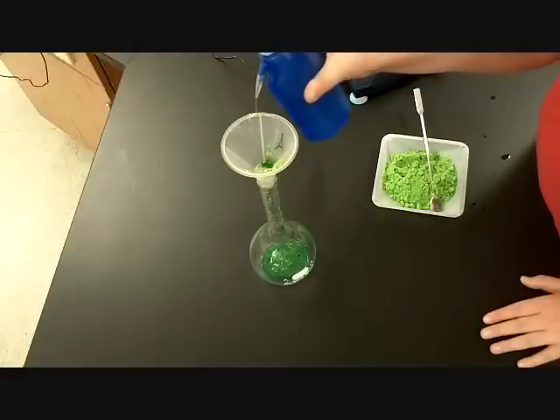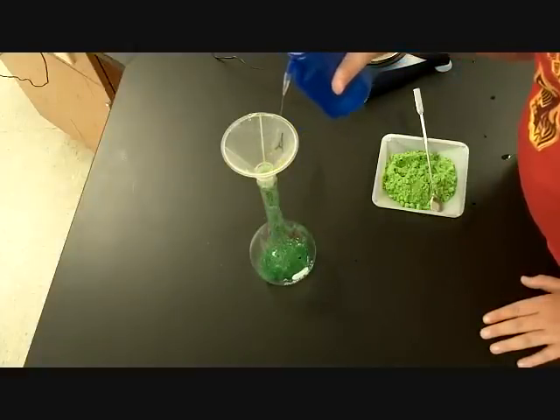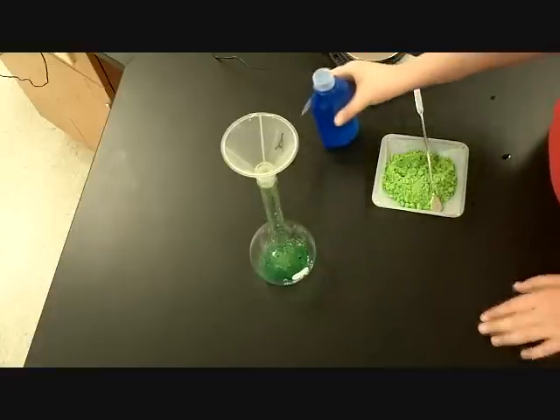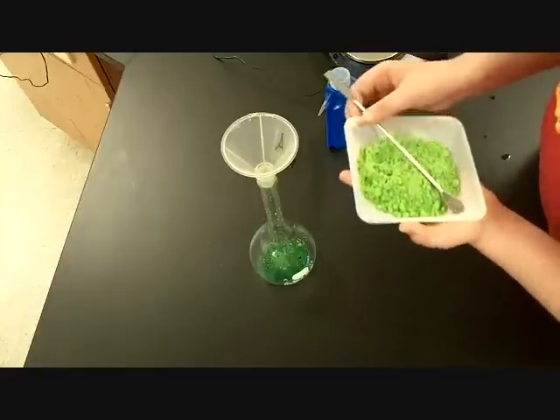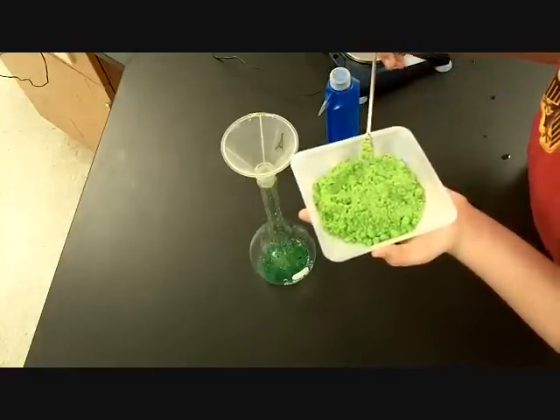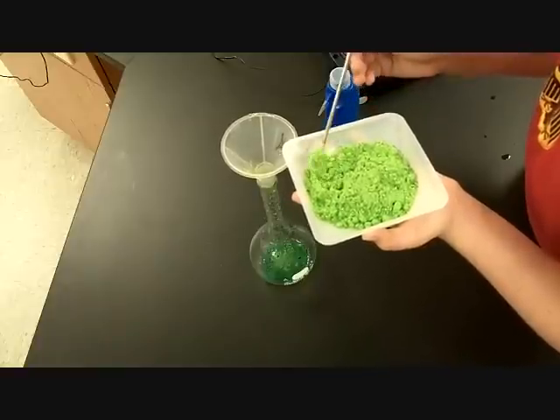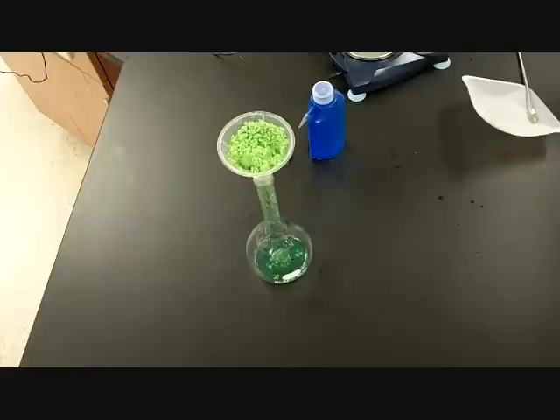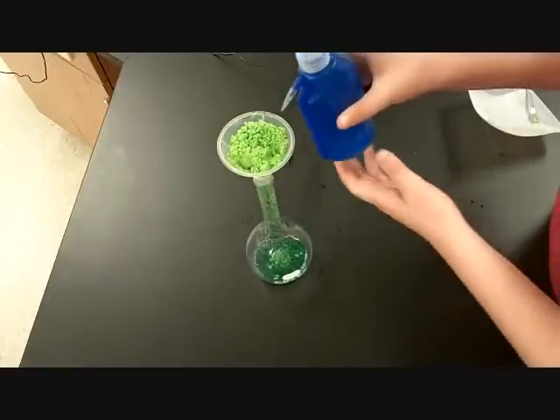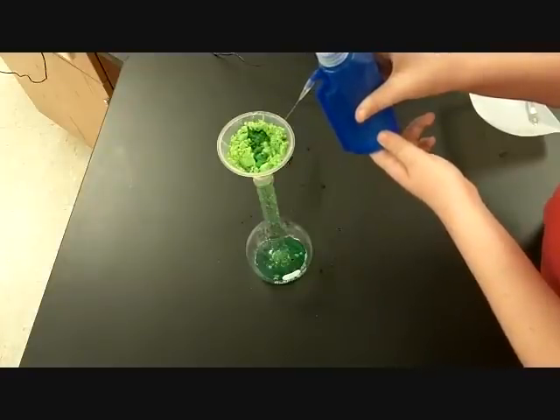Okay. All right, go ahead and add some more there. Good. Add some more nickel 2 chloride, carefully without spilling it, because we have exactly 97.19 grams of it. Awesome. Samuel, go ahead and rinse the rest of that down, and be careful not to squirt any on yourself. You got a lot in there, and that was a good job, bud.